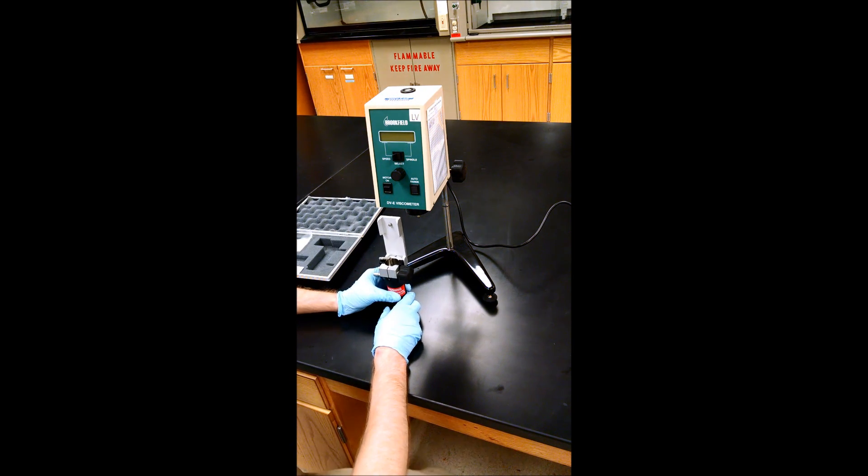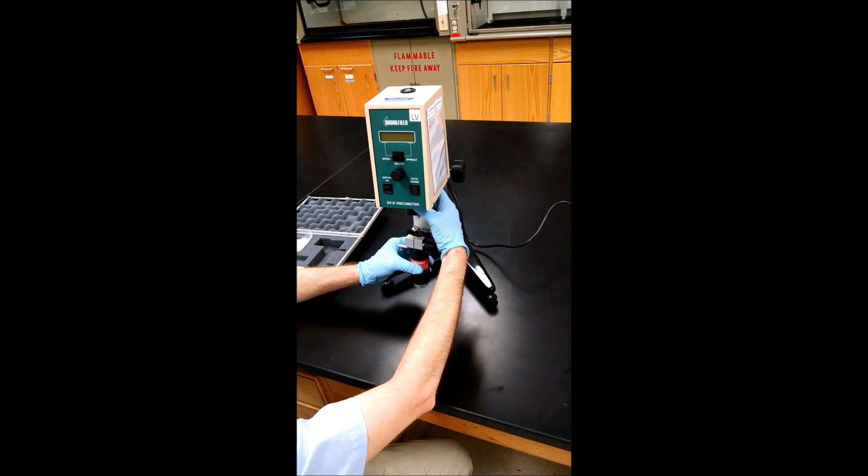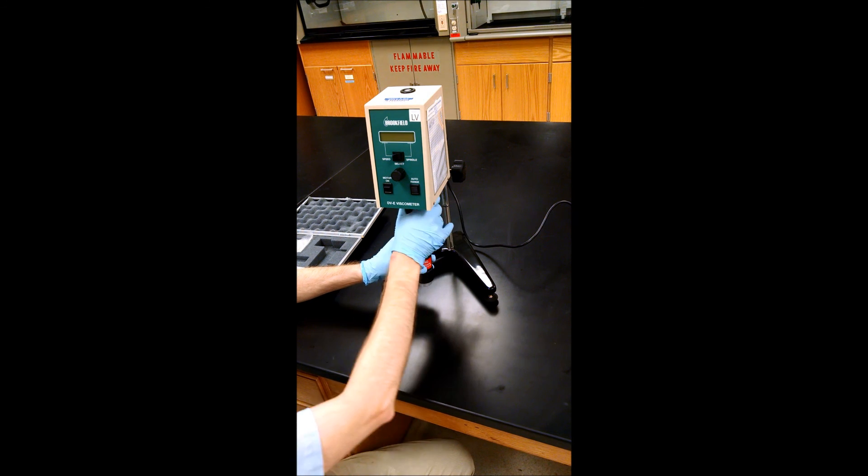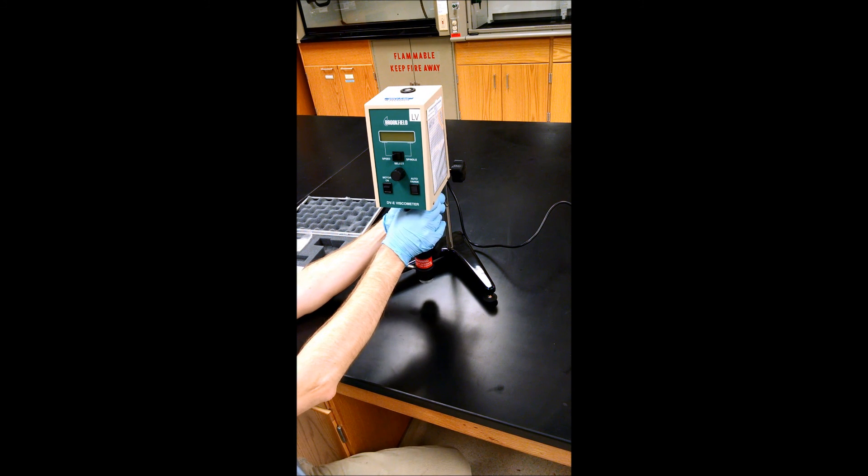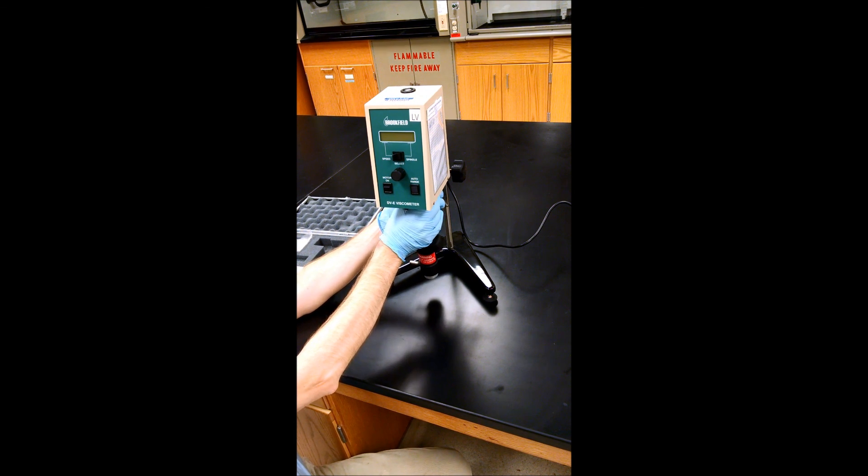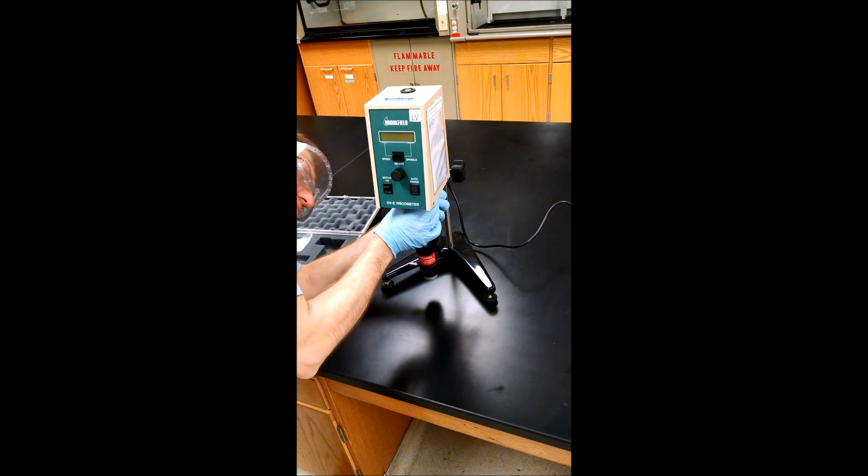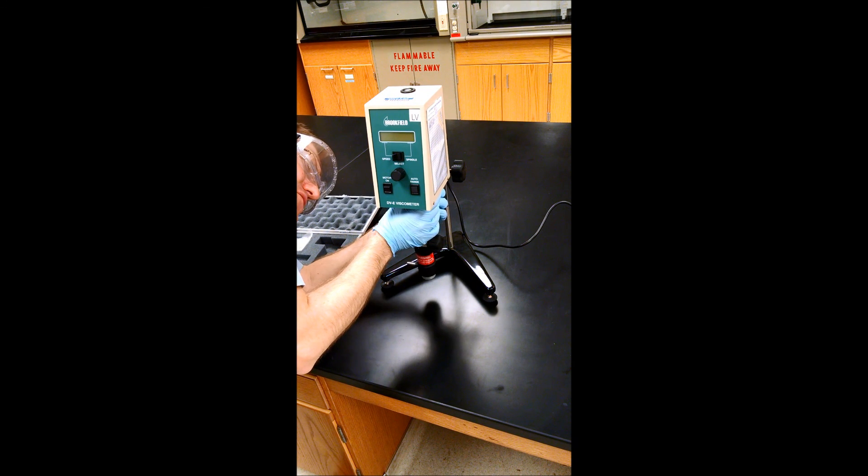Now we can attach the bracket to the viscometer. This is normal thread, righty-tighty.